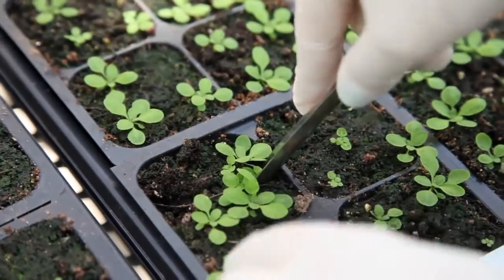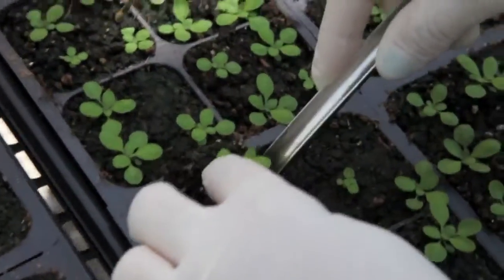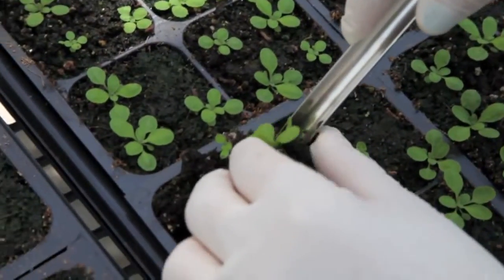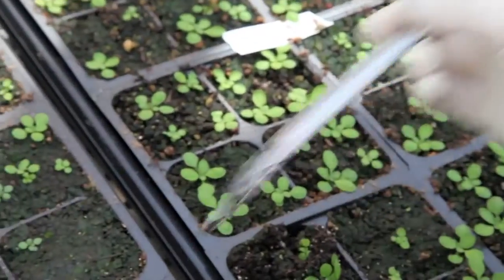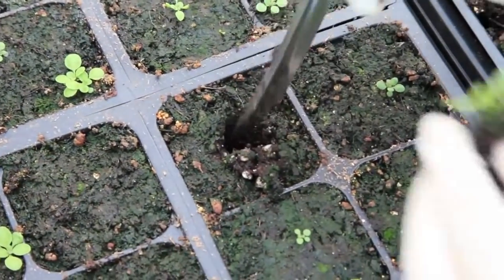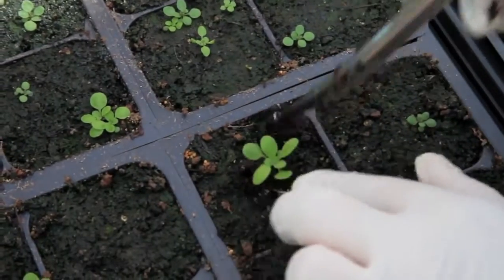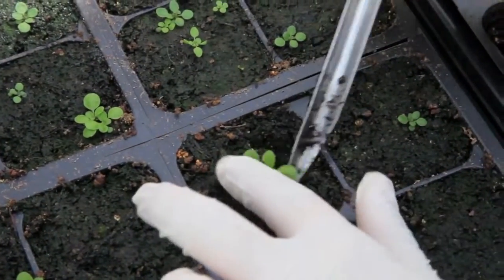In order to transplant seedlings while they're still young, use a laboratory scoop or other tool to pick up the entire plant with soil. Avoid disrupting the roots and place the seedling in another pot of soil with a similar sized opening. Make sure to gently pat down the soil and water the area to ensure that the transplant takes.